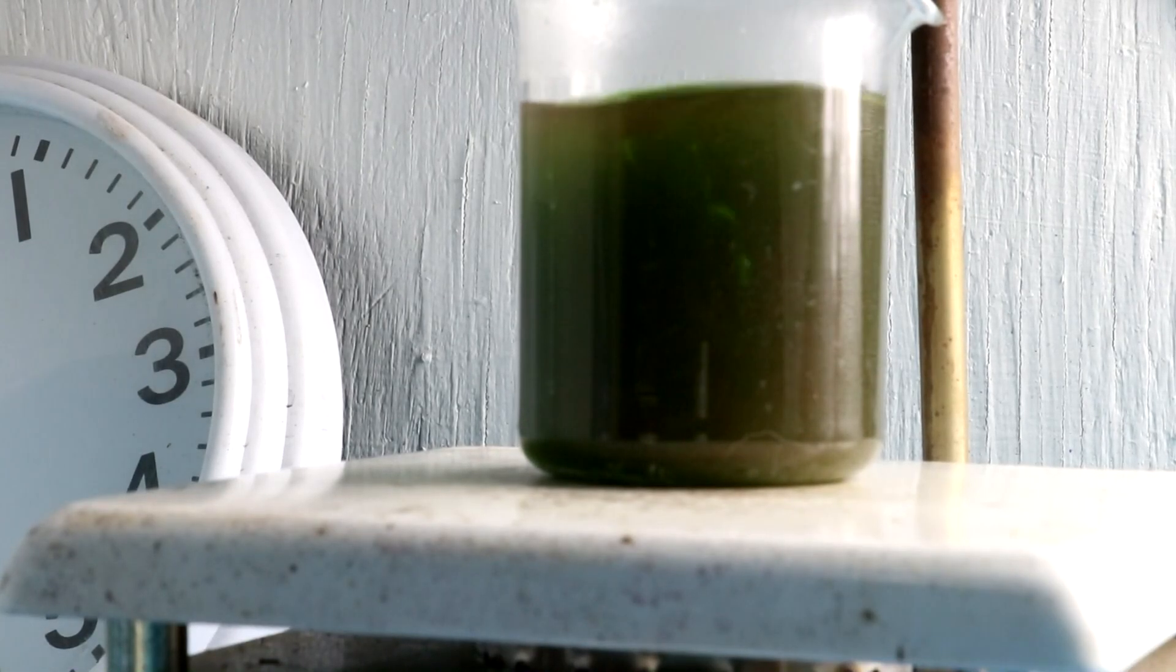You can see my stir bar is having some trouble. The stir bar is unable to spin properly because it's running into that copper powder.